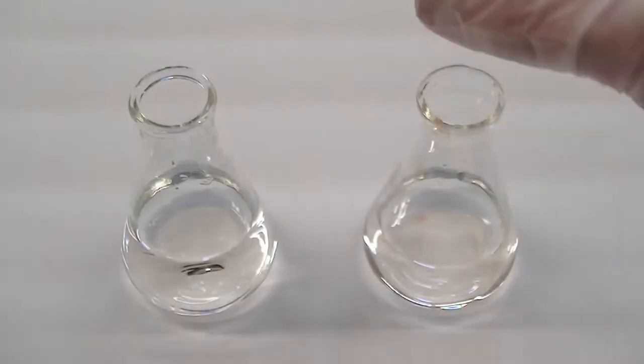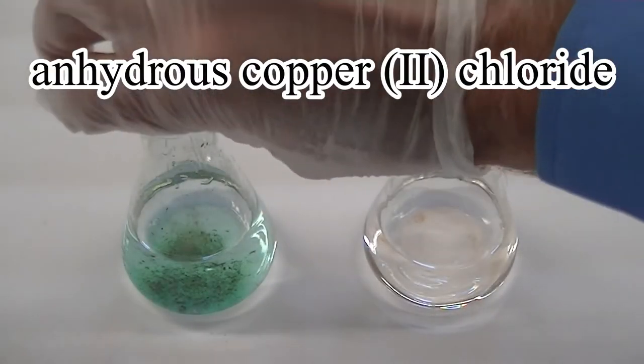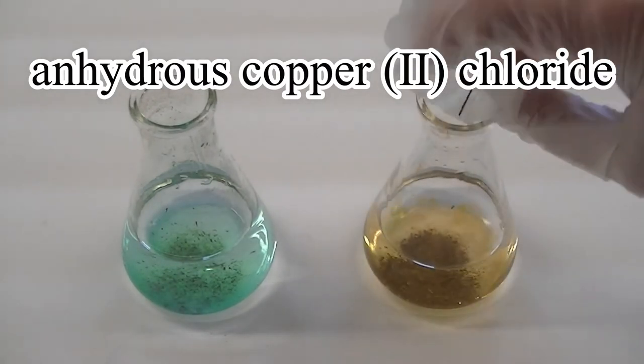To set up the experiments, we'll first dissolve some anhydrous copper-2-chloride in water. We'll also put some copper-2-chloride in acetone.